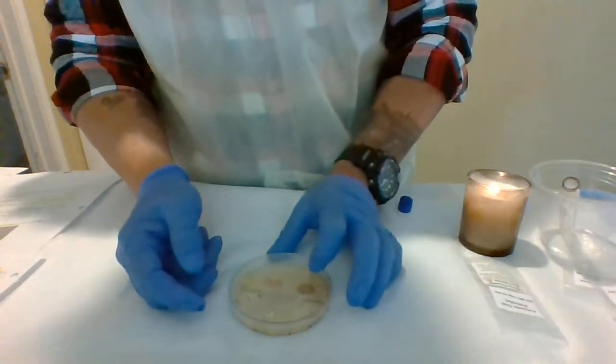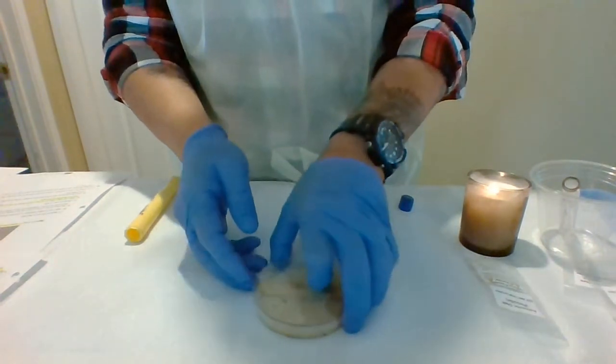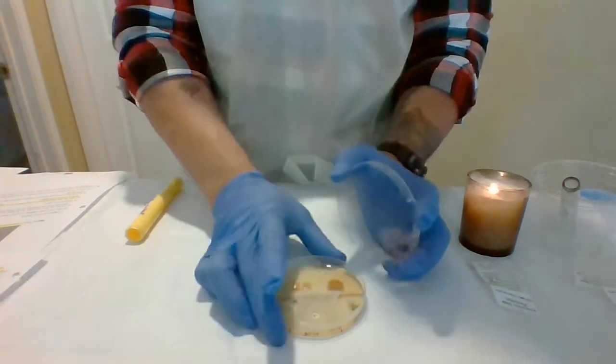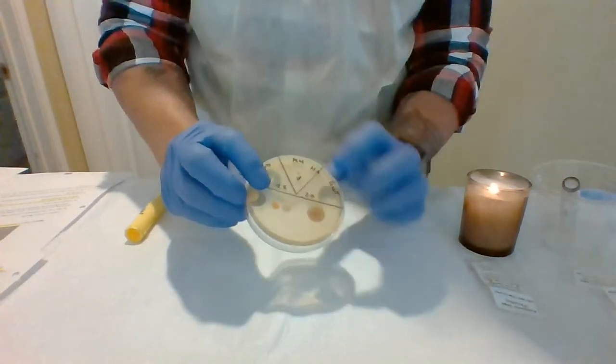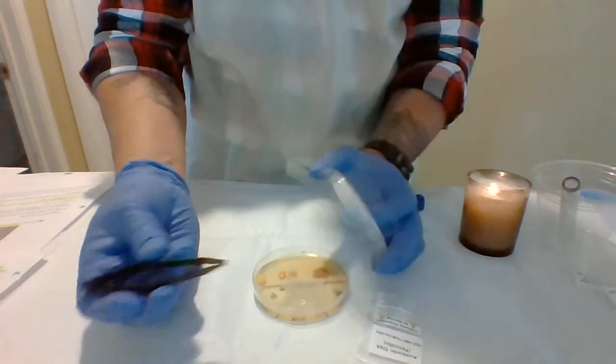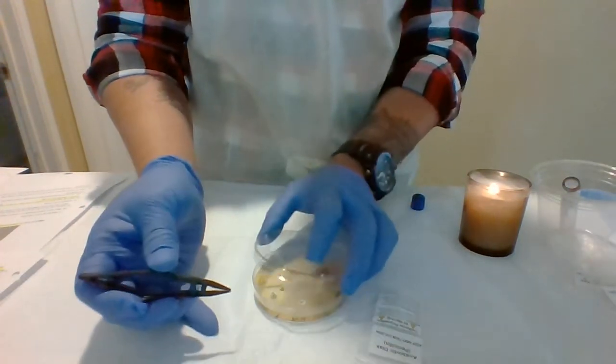So once that's done, I'm going to open the agar plate and quickly transfer the disc of the penicillin to the penicillin part of the dish that I said. So this is penicillin. So this would be the penicillin disc I would use. Grab the tweezers out of the alcohol, and I'm going to open the agar plate, and I'm going to press it gently into the agar to absorb.